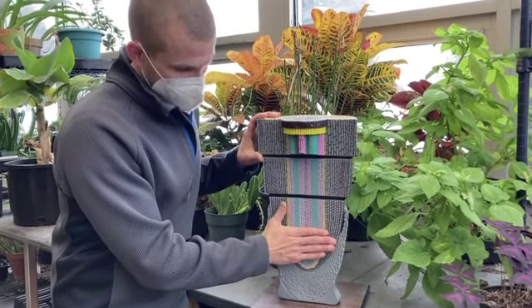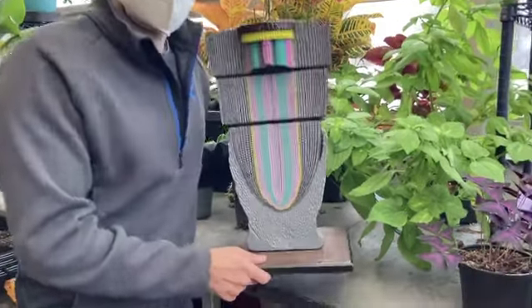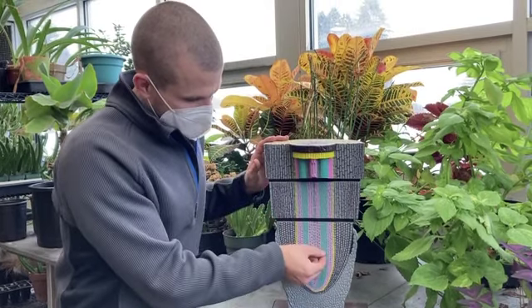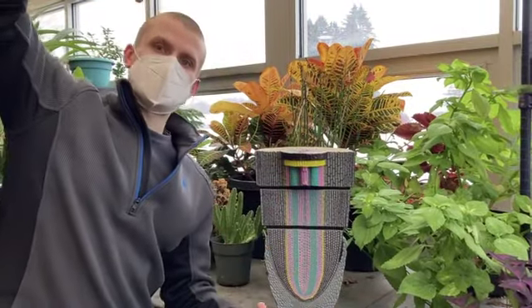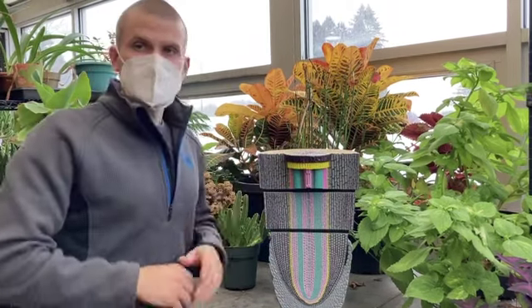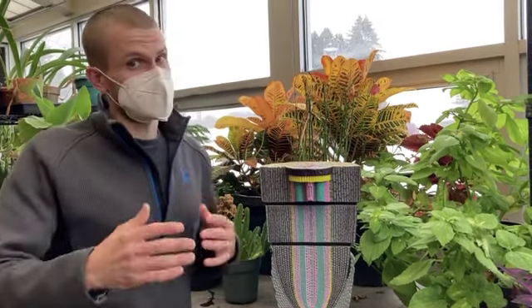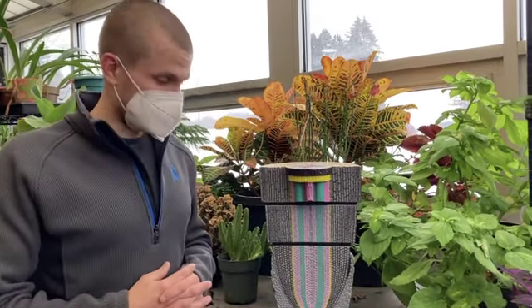The region of the meristem, where cells are dividing. You'll notice the cell size in all of this is much, much smaller in the region of the meristem, because as the region of the meristem proliferates, it then drifts up into our region of elongation, and the cells begin to lengthen. Their cell walls expand in the region of elongation. And then last but not least, up top, we have the region of differentiation. The region of differentiation is where you get that full maturity of the cell to become xylem, to become phloem. Remember, xylem dead at functional maturity, phloem still alive. The difference in those sieve tube cells versus companion cells.